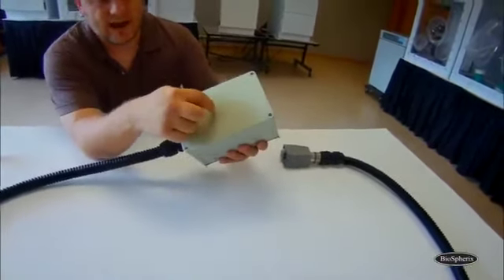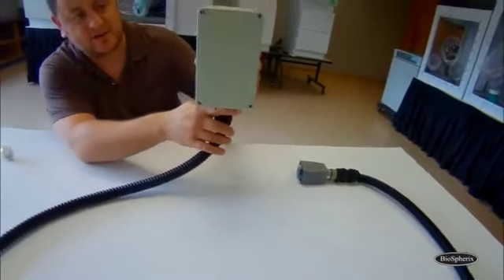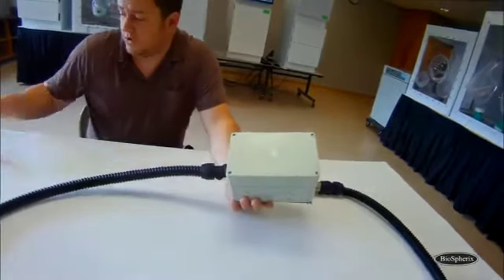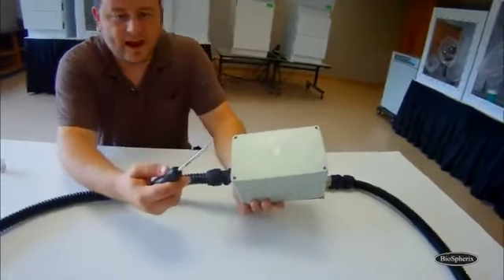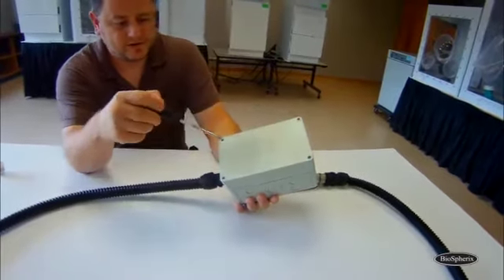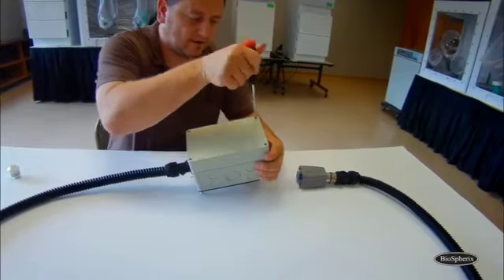But we need to get inside of it. If you have a lot of room to operate, you can leave it right attached to your animal chamber. It'll just sit there like this. But you only need one tool for it, a flathead screwdriver, because you have 4 screws in the corner, and we need to open those up to take the cover off the pod.